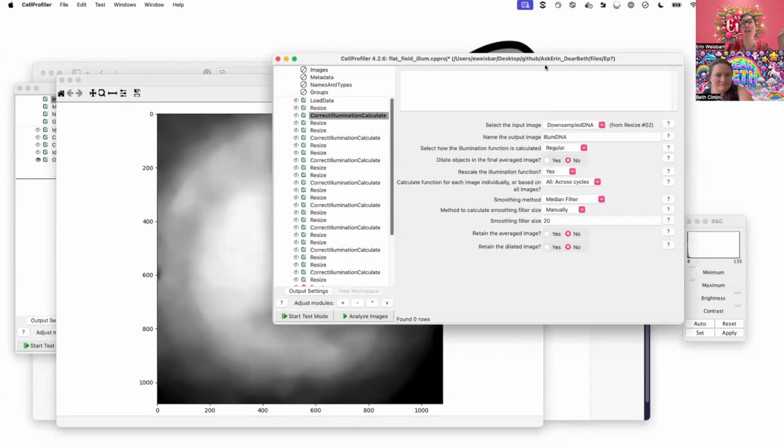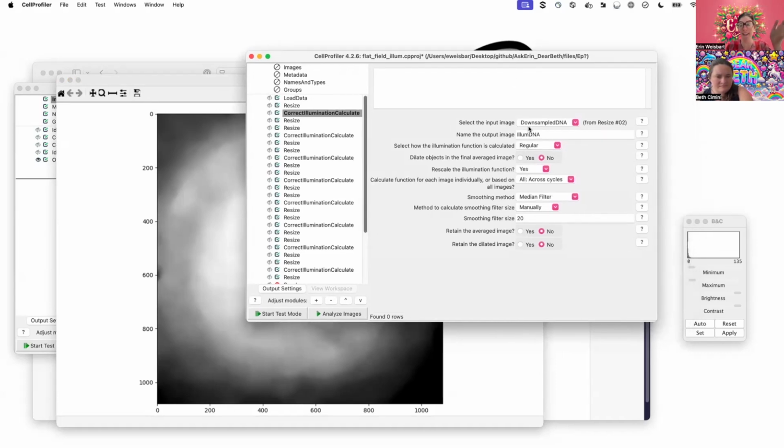Then here is the Correct Illumination Calculate module. This is where we'll go over what the settings are that are different from over on the left, which we'll talk about shortly. So I've got an input image, I'm going to output an image, and you get to give it a name.